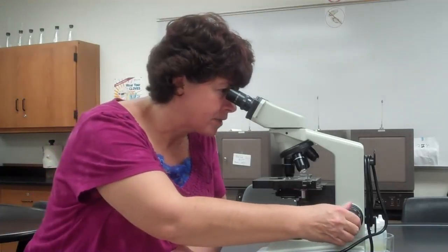Now I'm focused on the 40. I can now go to the 100. Now I don't go directly to the 100. You must use oil immersion. It is not an option. You may say, well, I can see it under the 100, which may be true. You'll see something blurry. Two things will occur. Either it will be the wrong color or it will always be out of focus. You must use the oil immersion to decrease the refraction of light so that you get a clear, visible specimen and it is the right color.